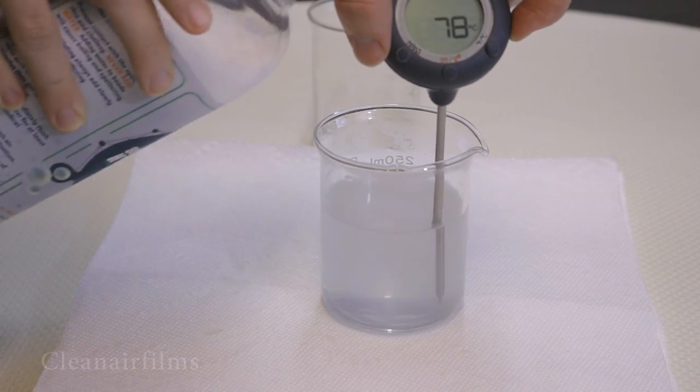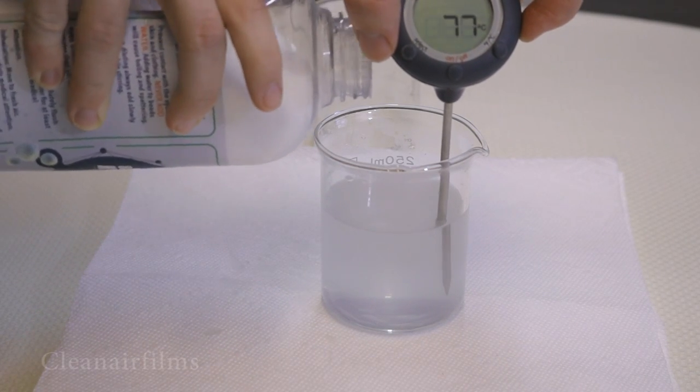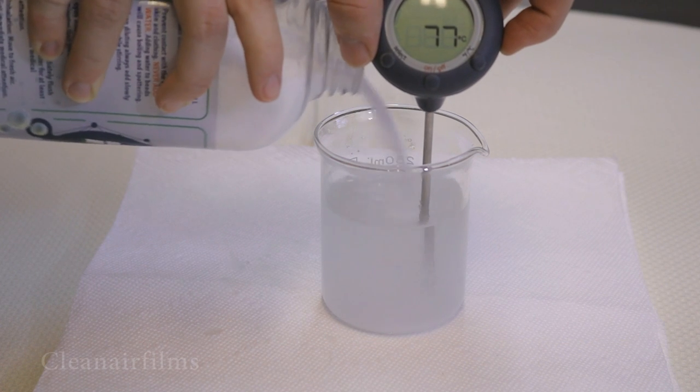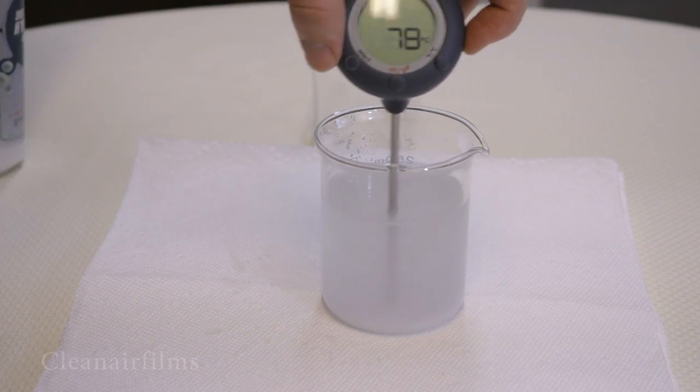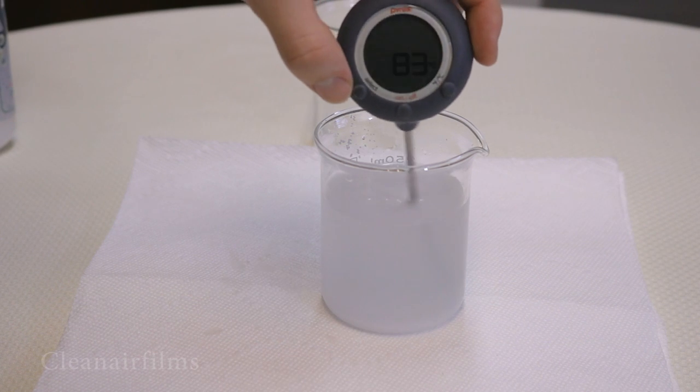Let's add just a little bit more lye to the solution. The temperature is rising quickly now.